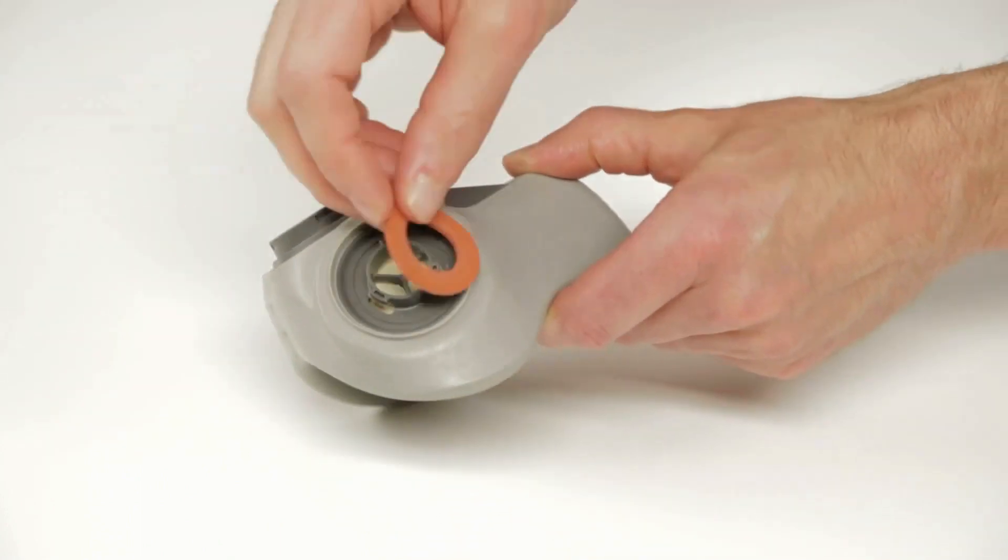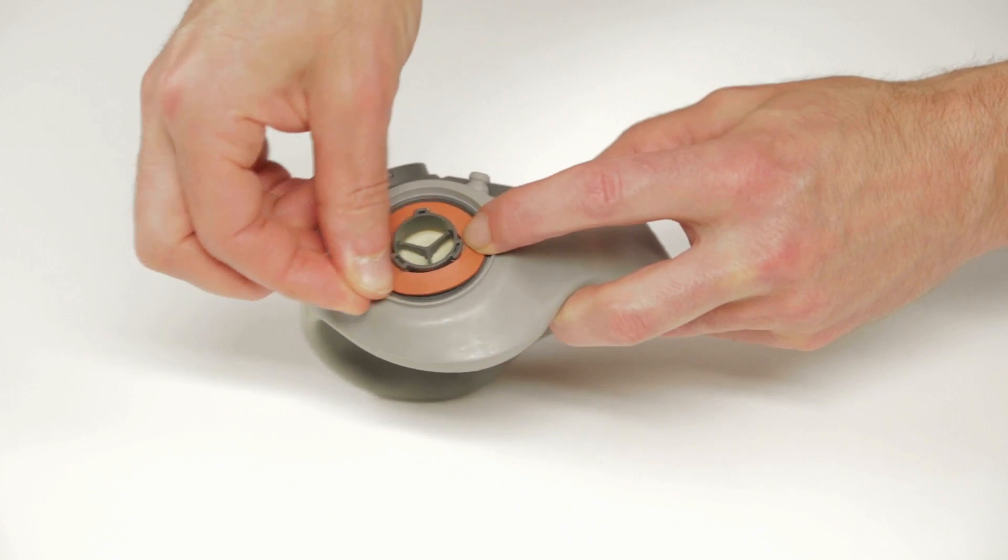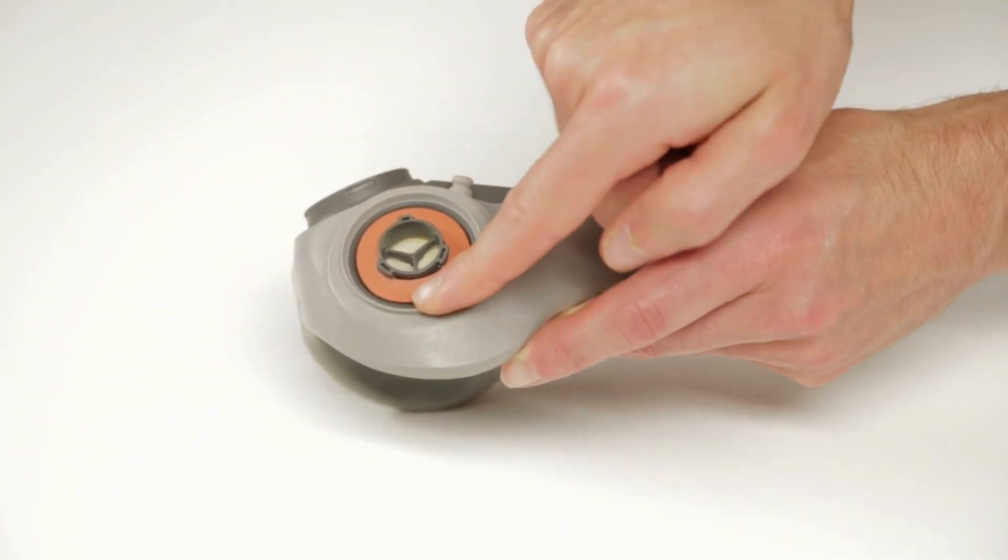When installing new inhalation gaskets, make certain they are in proper position under all three bayonet lugs.